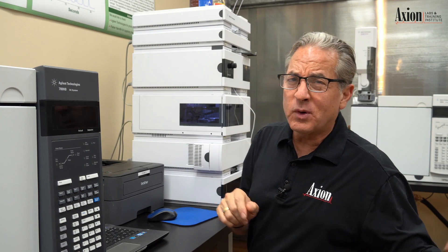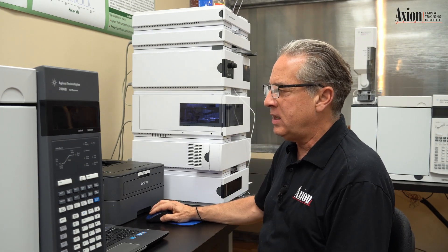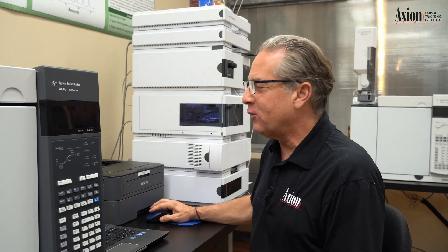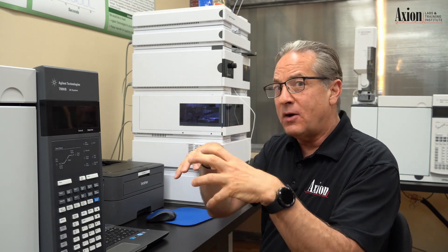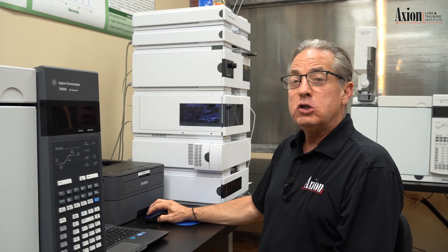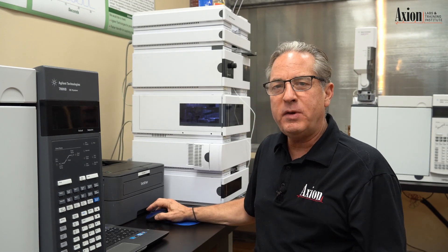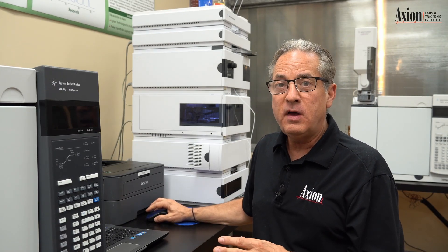Let me show you in the software a real simple way to fix that. In the diode array setup, we tell it what sample wavelength we want - 254 nanometers, by far the most popular wavelength, good for benzene rings. With a bandwidth of 20, we're looking at everything from 244 to 264, adding all those diodes together and averaging them for a nice high signal and low noise. By default, we subtract everything up at 360. If you're getting negative peaks later in your chromatogram - probably because you have brightly colored compounds - simply shut off the reference wavelength, and the problem goes away.